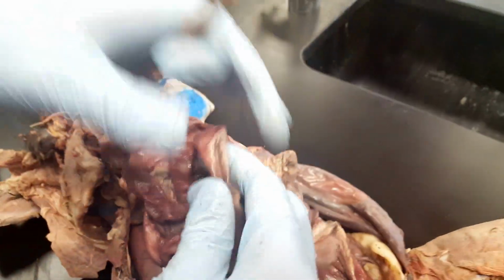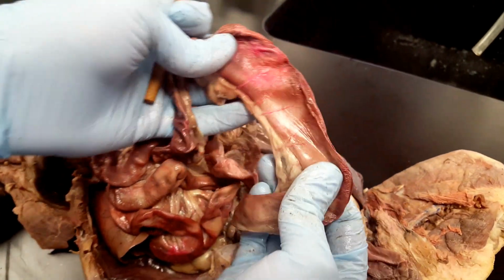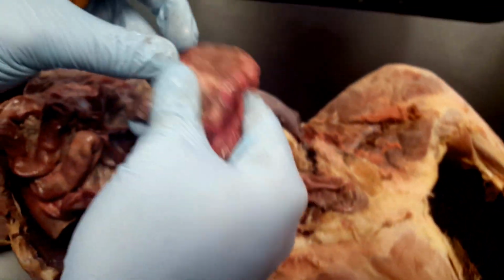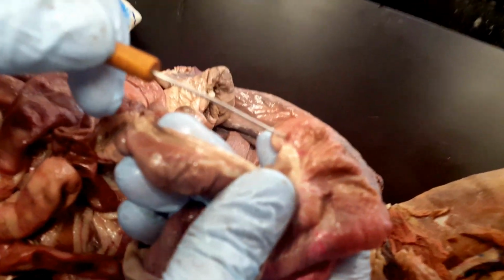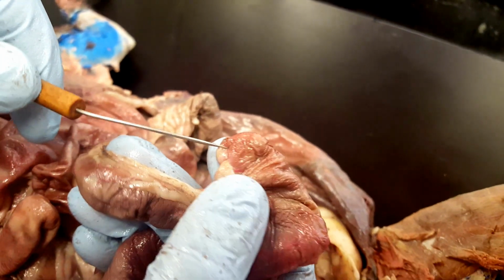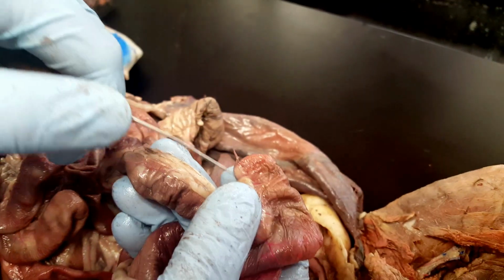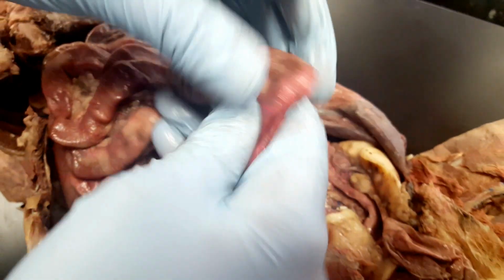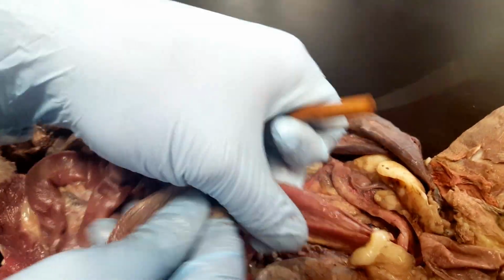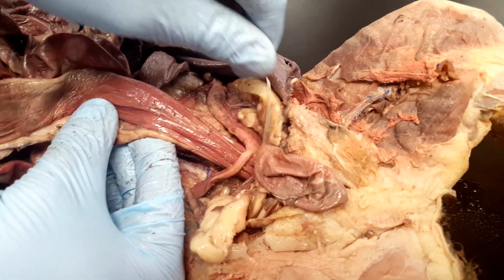Just hold the ileum there. It's going to end at the large intestines here. You can see the large intestines. The diameter is much larger than the small intestines. And there's this little pouch at the end of the large intestines. This is the cecum. If this was an herbivore, this would probably be a much larger portion. Just a little pouch at the end, so you know you're at the small and large. The large intestines turn into the rectum, which we can then follow all the way out if we wanted to.